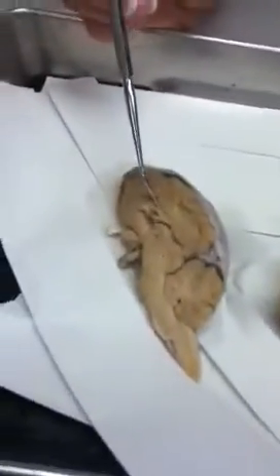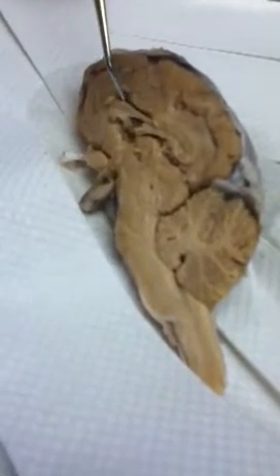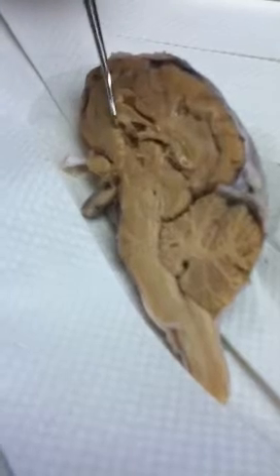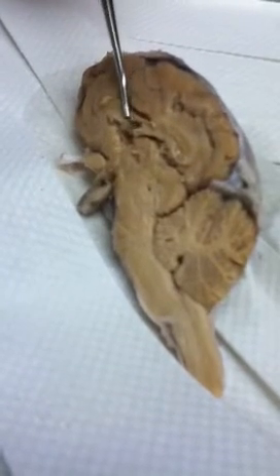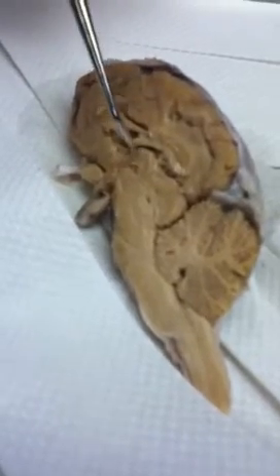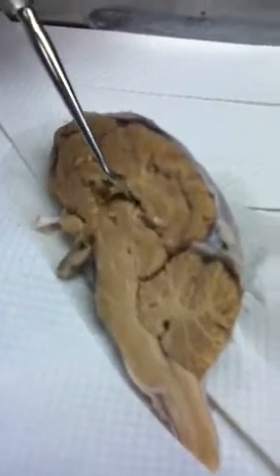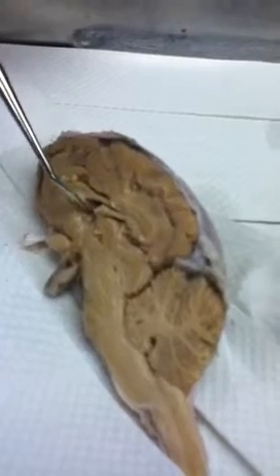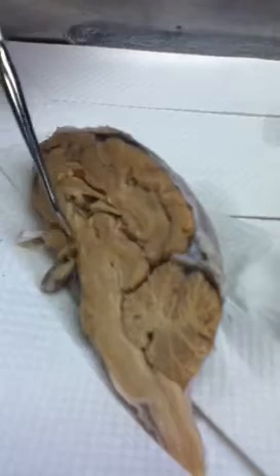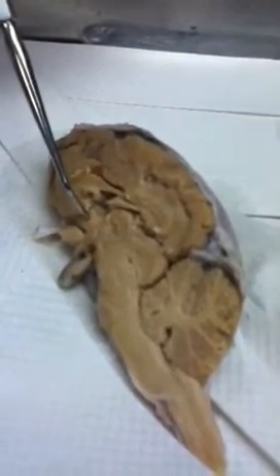On the half brain, additional structures. Going around here is the corpus callosum. The space inside of the corpus callosum is the lateral ventricle. And covering the lateral ventricle, there is usually a thin piece of tissue called the septum pellucidum. Underneath the corpus callosum, you have a space, that's the third ventricle. This circle-like structure that obviously was dug out here was the thalamus.